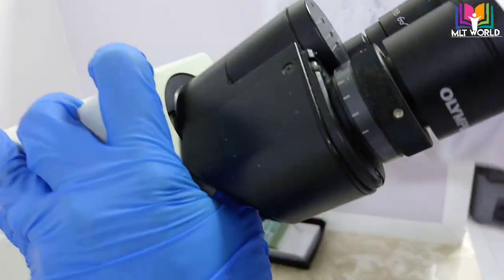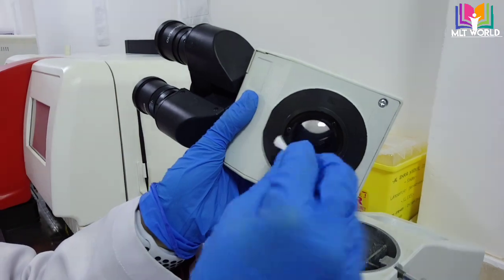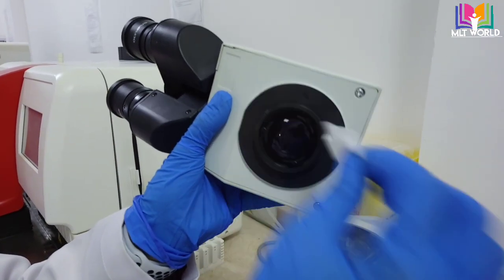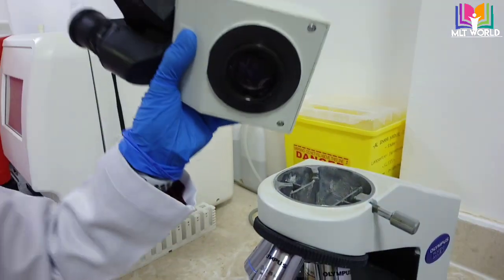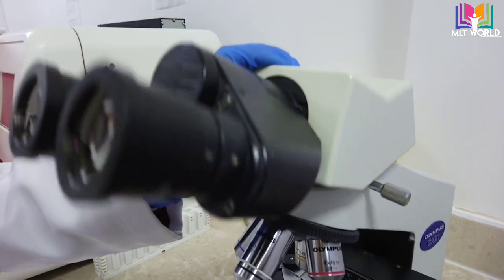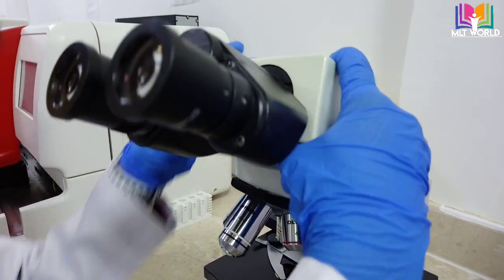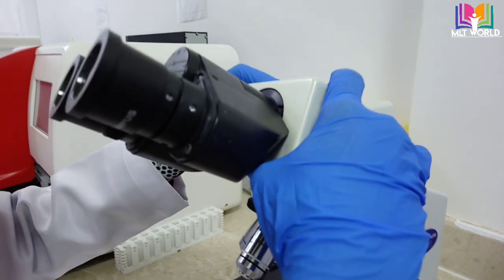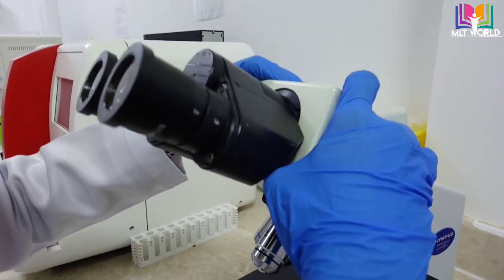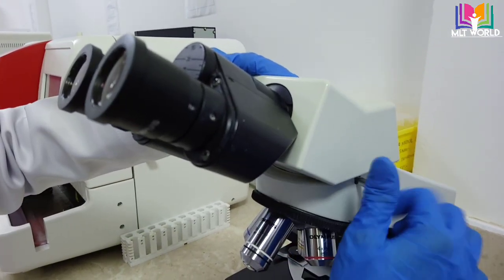Now, this eyepiece area also we can clean. Now you see, like that. And then you can fix it back and tighten this area.